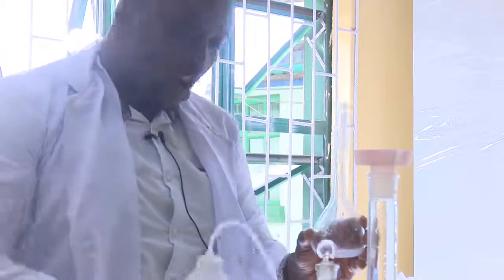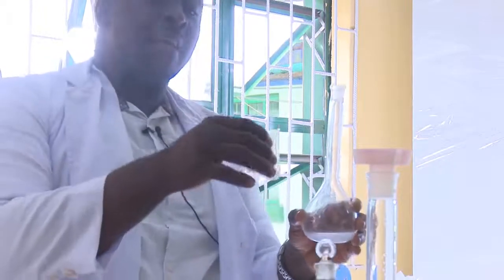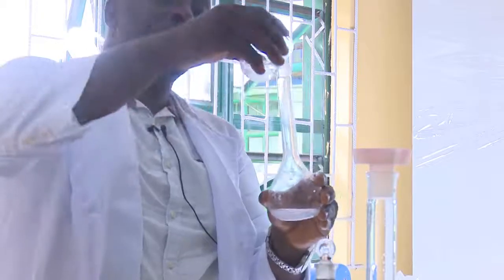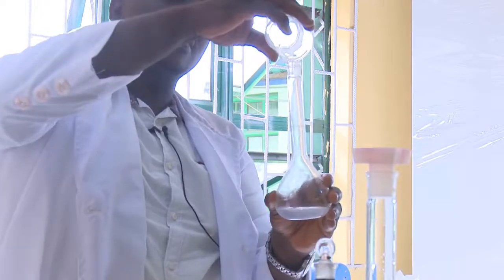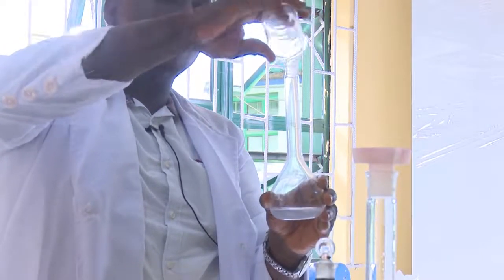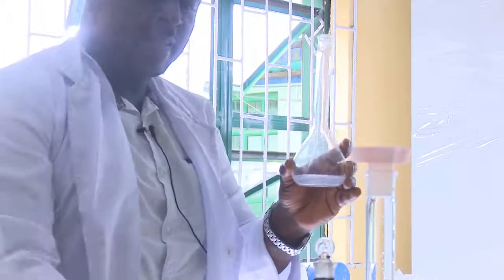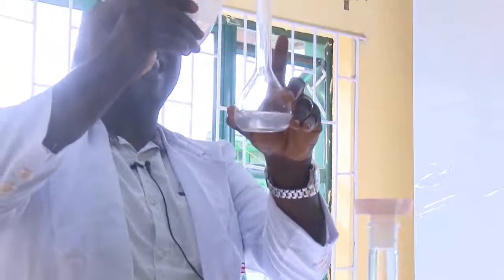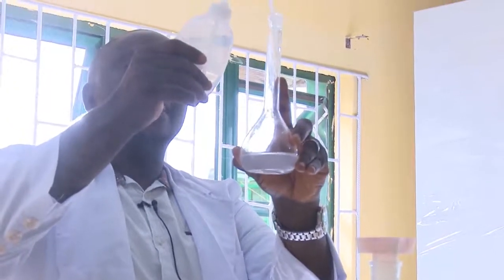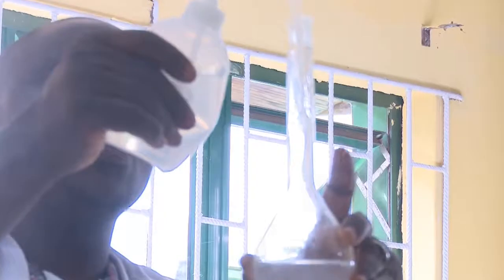Now we are going to make this up after rinsing the beaker repeatedly to ensure that every part of the chemical I mixed earlier is taken out and poured into the standard volumetric flask, so that we can have the exact concentration calculated from what we predetermined. Yes, we want to prepare what? 1 molar. So having done that, now I take my wash bottle containing the distilled water and make it up to the mark. If you look at this standard volumetric flask, there's a round ring, a dark brown line around the neck, showing that this is where we are to stop.